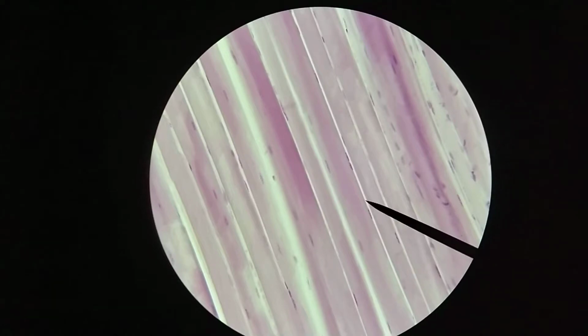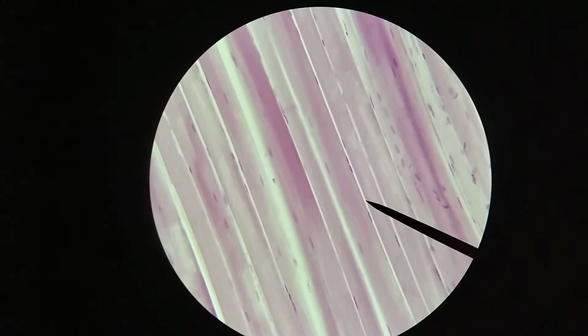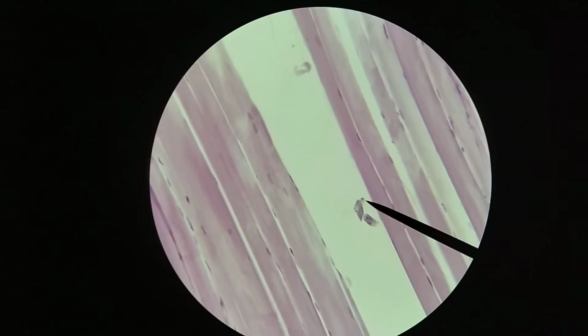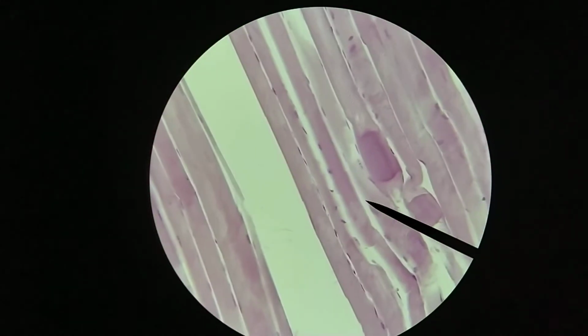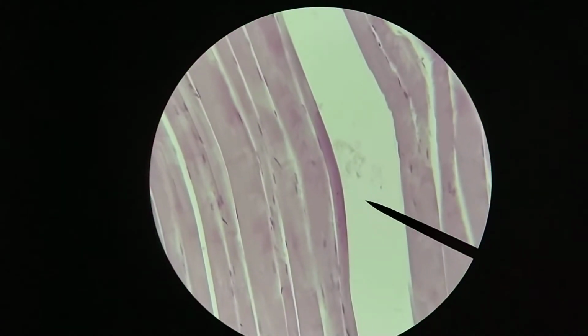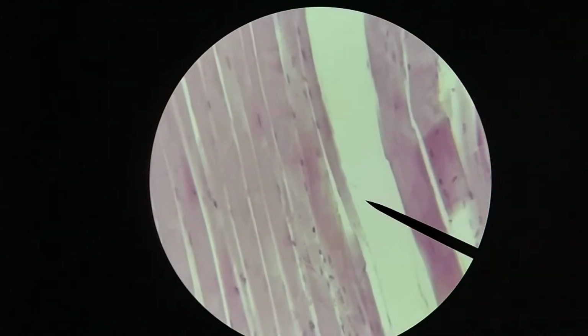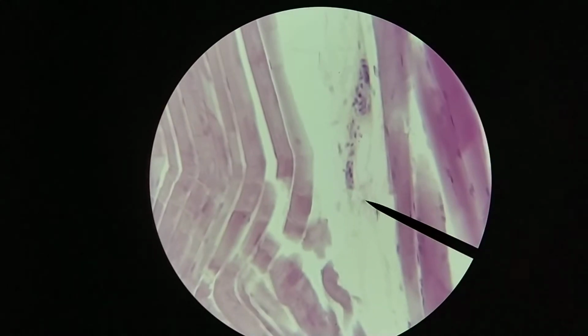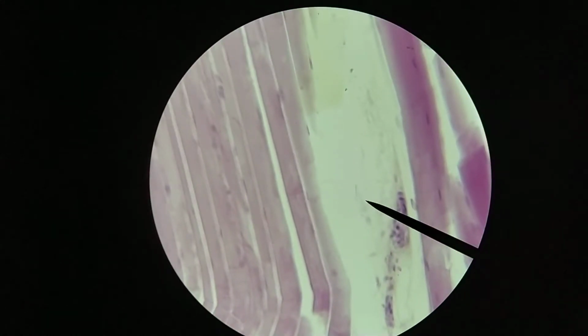Now this space down here, this little gap between the cells, would be filled with a little bit of connective tissue as well. And this connective tissue in here would be known as the endomysium. Endo meaning within, so within the muscle fascicle you have endomysium, whereas at the edge of the fascicle you have the perimysium. You can think of peri as in around the outside of something, the perimeter of something. In this region here we would have a slightly thicker layer of connective tissue with some small blood vessels, small arteries, small veins, whereas the endomysium is likely to contain capillaries.